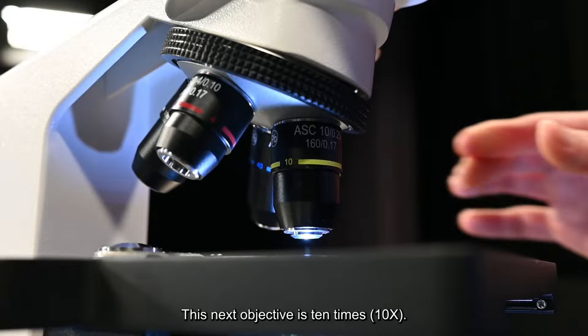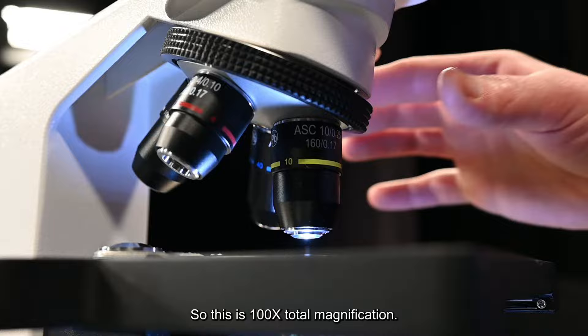This next objective is ten times. So ten times ten is a hundred. This is a hundred times total magnification.